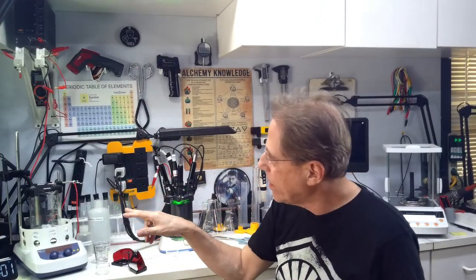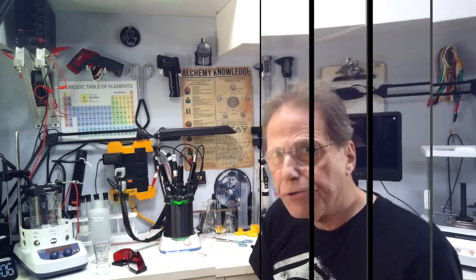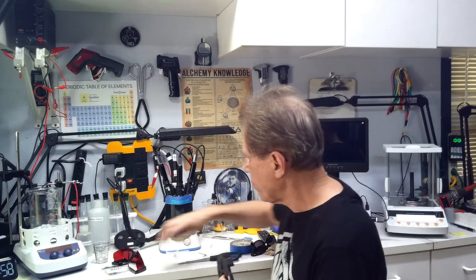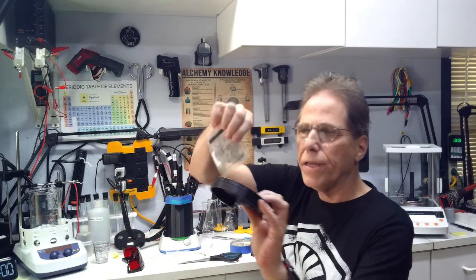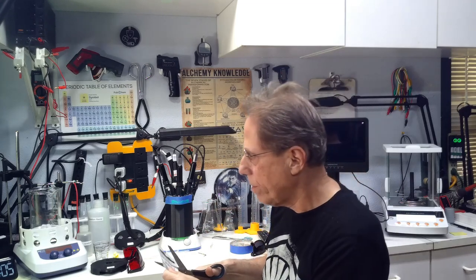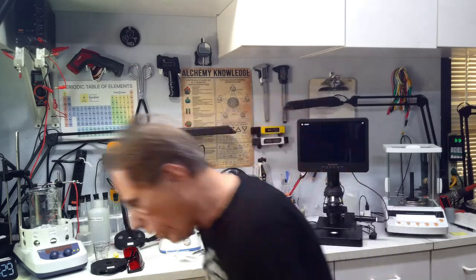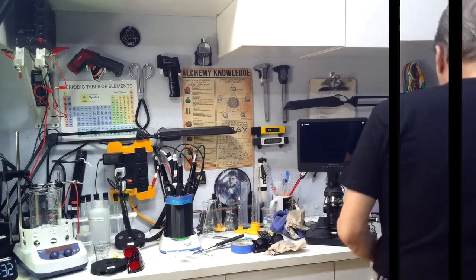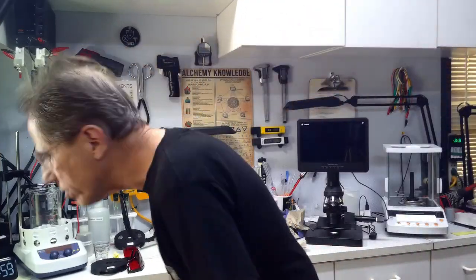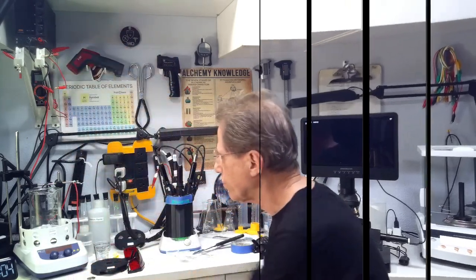Now I'm going to get the stuff together to show you what we're going to do with the iron experiment. This is a special top — I call it my coin top — so we can load the coins in the top here. This is a brand new coin — I call it a piece of iron. We're going to take this and weigh it on a four-decimal-place scale. We'll see a lot of material come off of this, because unlike the laser process, a lot of material comes off doing something like this.